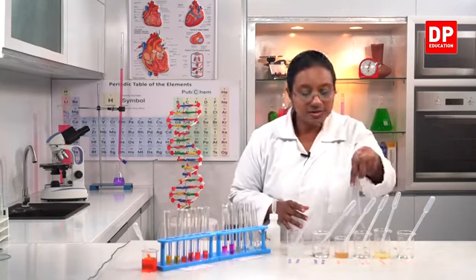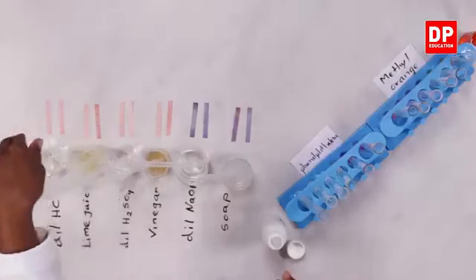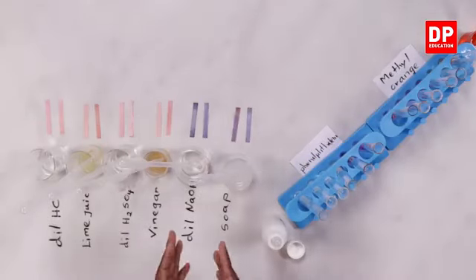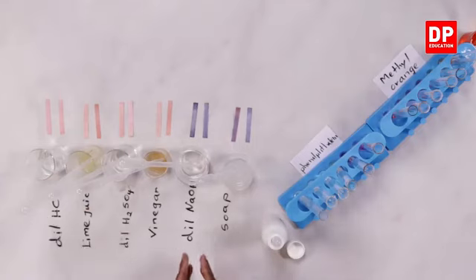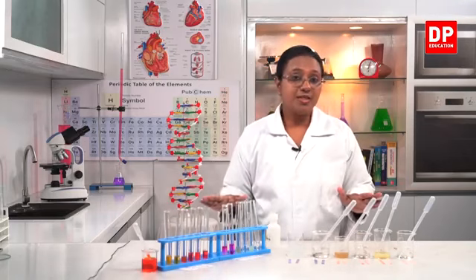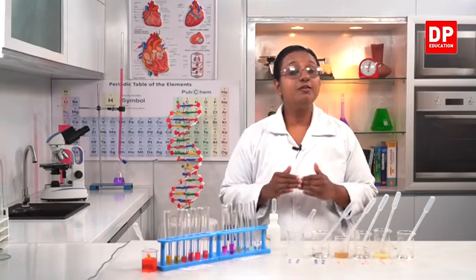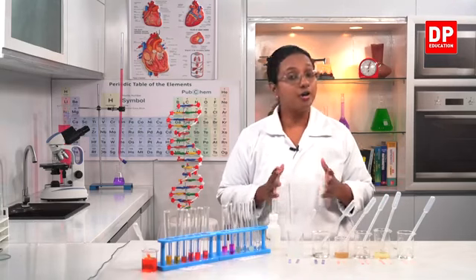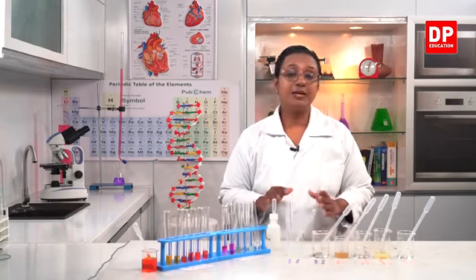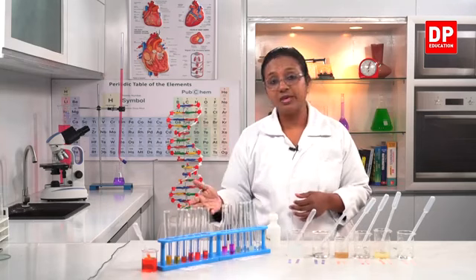Is there a difference in the color change? There is no difference. All these give red color with blue litmus. Same way, sodium hydroxide is a strong base whereas soap is weak. But still you can see the color change is similar. Here also the same. So from all these indicators, we can only identify whether a solution is an acid or a base. But we cannot determine whether it's a strong acid, weak acid, or strong base or a weak base.